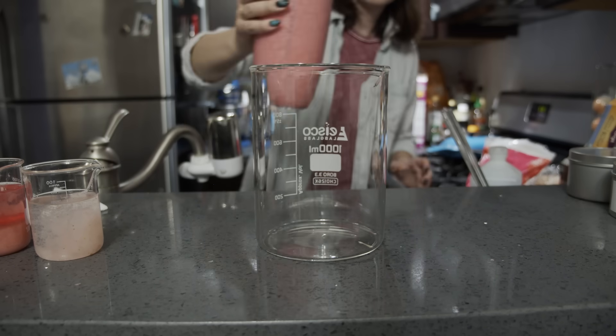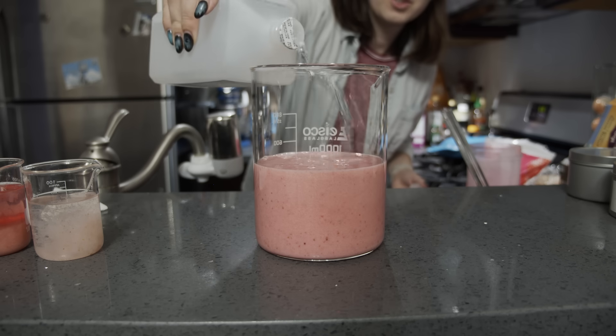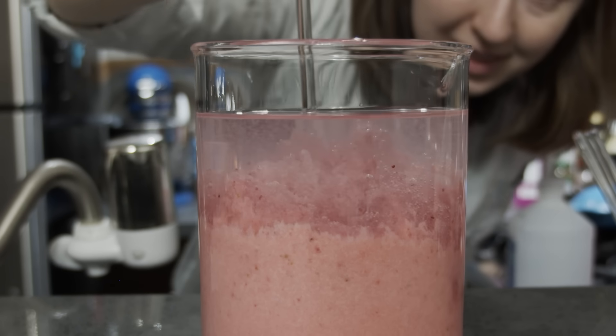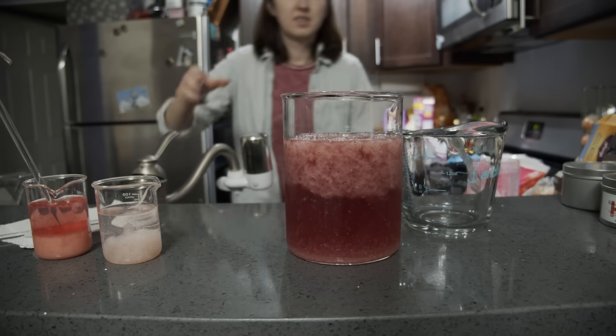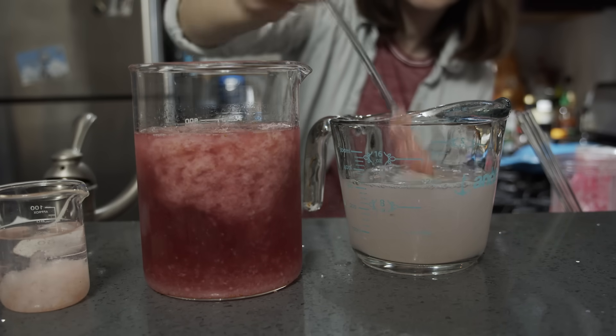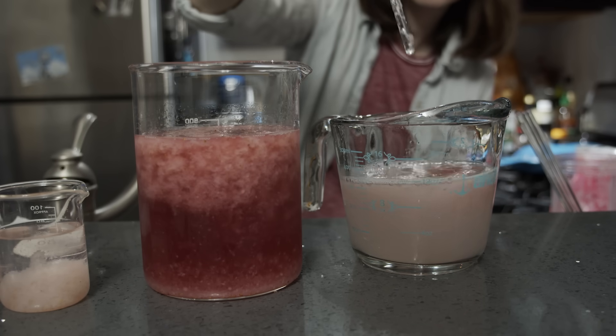So all of this together can help make a flame retardant. So I extracted a bunch more strawberry DNA for testing. I decided that purity here is a little less important than quantity — I want lots of DNA, I know I'm losing some in the wash steps, so I just extracted a big quantity and we'll see how it goes. It did pick out some wayward strawberry seeds though.